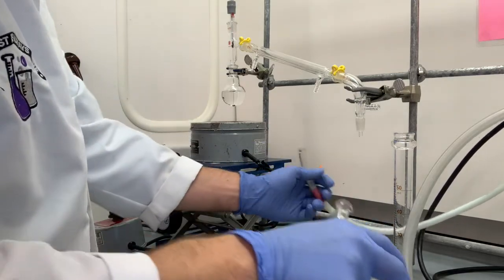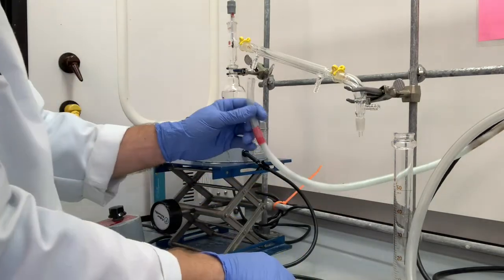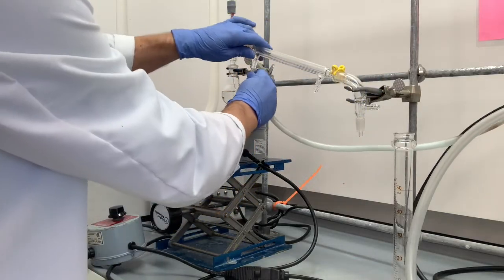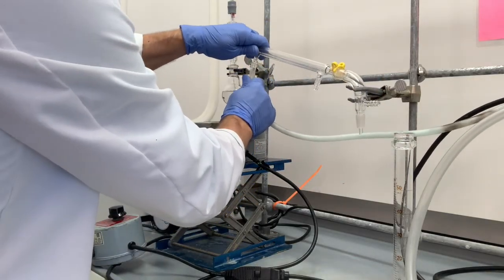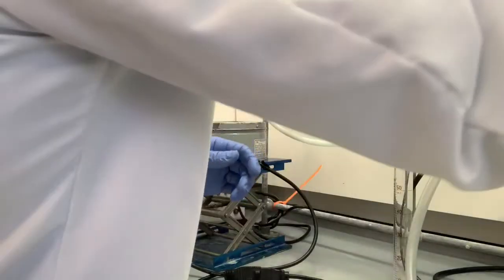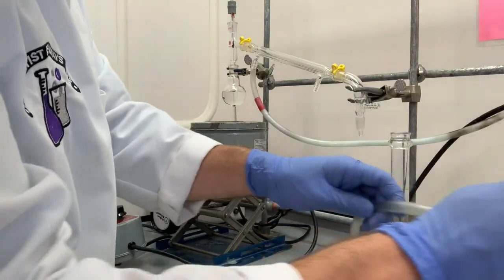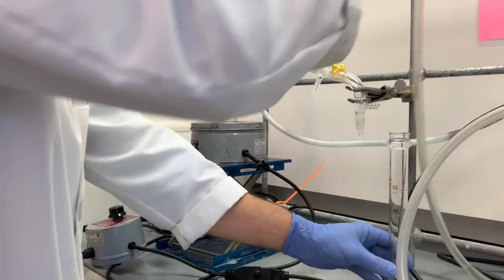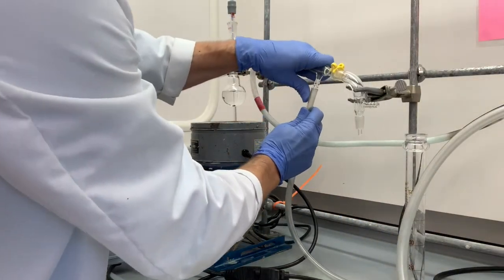The way we have this set up is that the red tape indicates the exit where the water is going to leave. So I'm going to set that right here. Connect it to that point. And then the cold water coming away from the pump has a blue tape that's going to be connected right here.